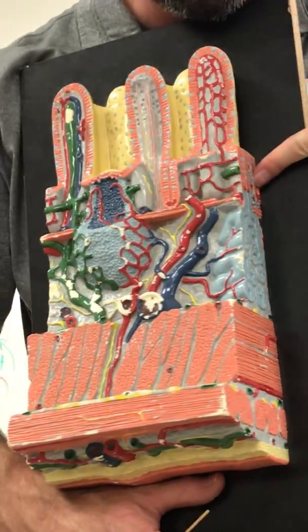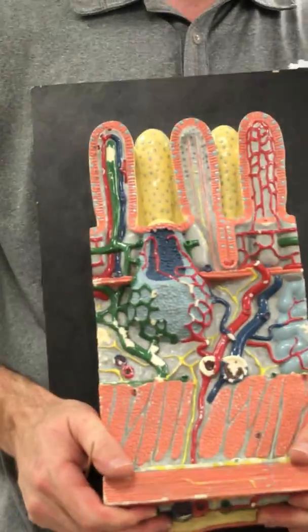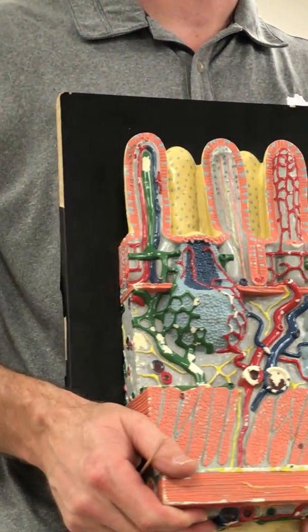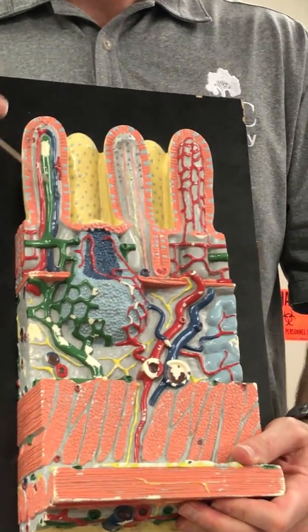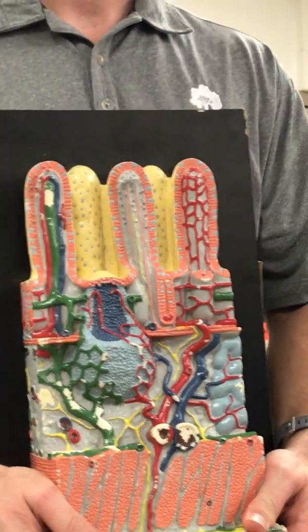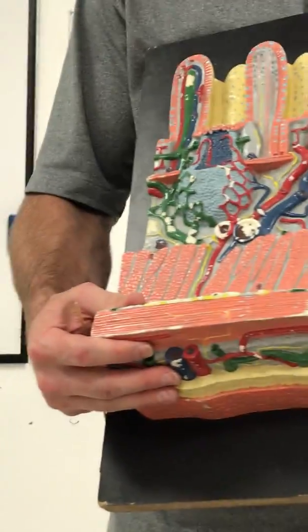And then this gland here and here and the two on the side, these are mucosal glands, which you would call what in the small intestine? Intestinal glands or crypts, intestinal crypts. The green here, and then the rest of the green: collecting vessels. I think that's it.